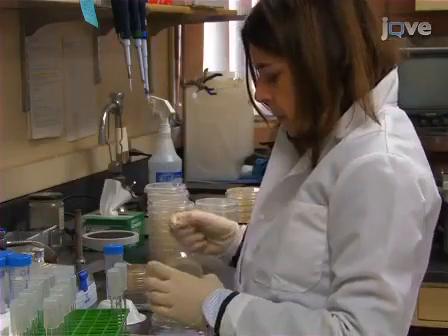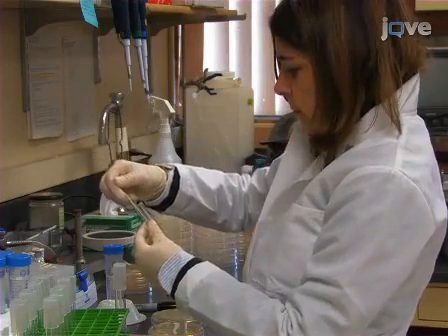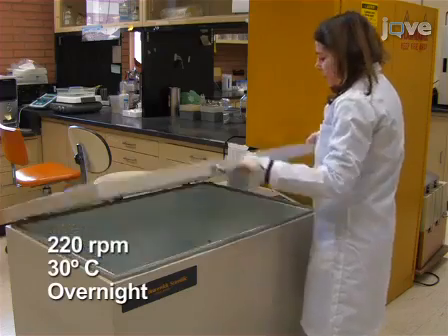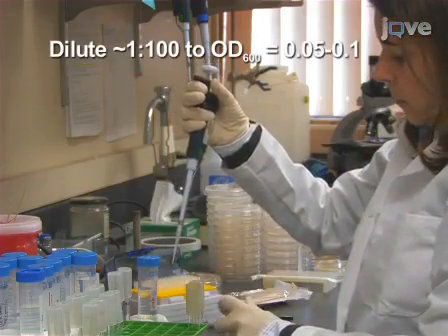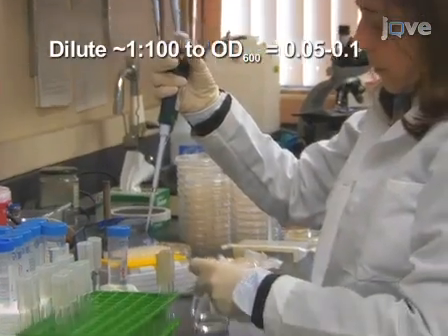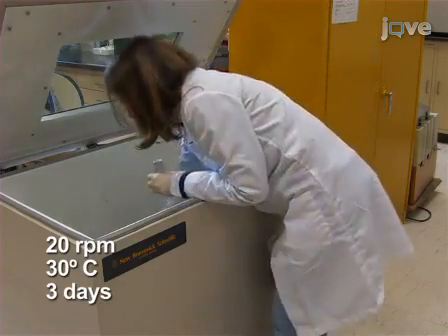To assay for yeast chronological lifespan, or CLS, first inoculate a single yeast colony into 1 milliliter of synthetic complete glucose, or SDC medium, and incubate overnight with shaking at 30 degrees Celsius. On the following day, dilute the overnight culture into 10 milliliters of fresh SDC medium to an OD600 of 0.05 to 0.1. Incubate with shaking at 30 degrees Celsius for 3 days.